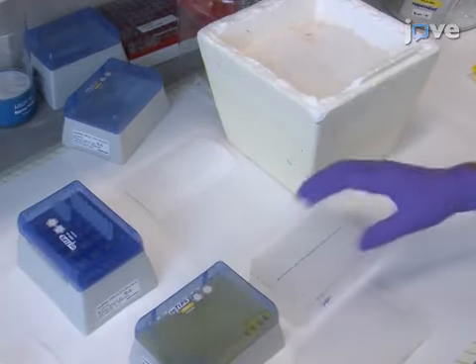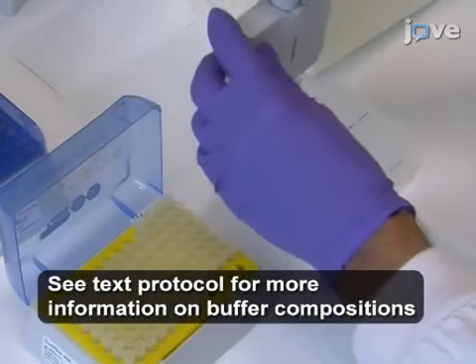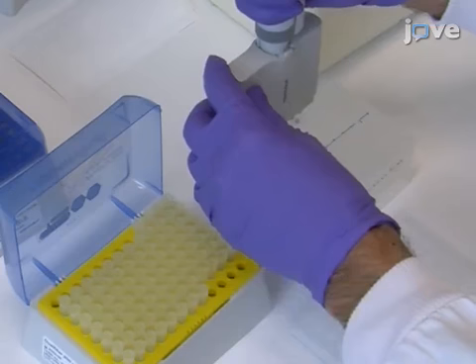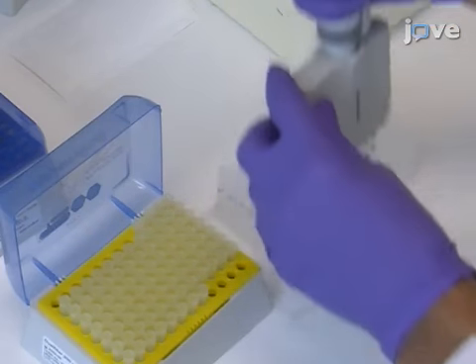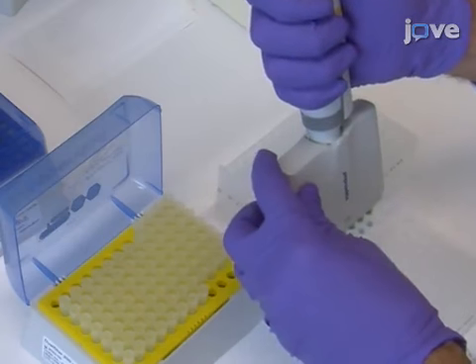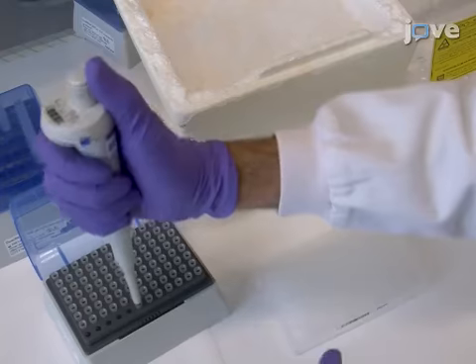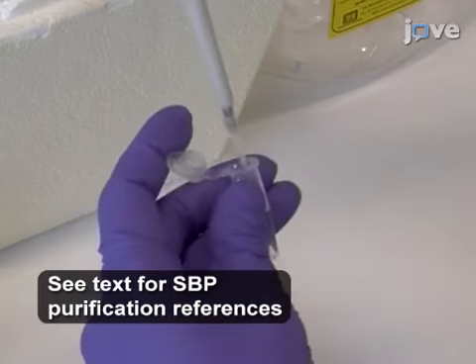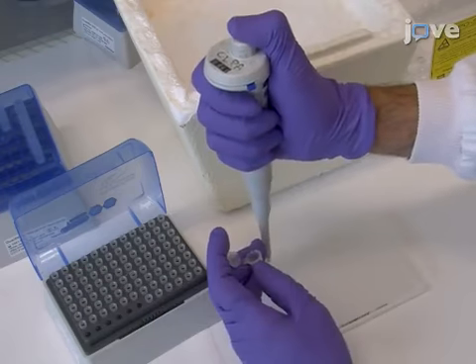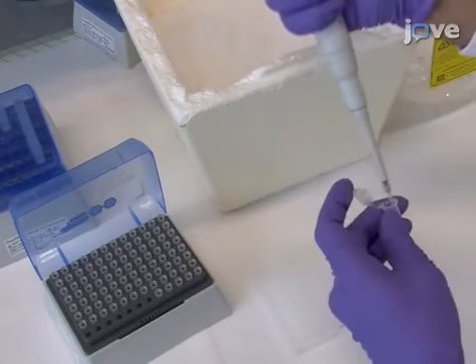First, prepare 48 buffer solutions with a pH range of 4.0 to 9.5 and sodium chloride concentrations ranging from 0 to 0.5 molar. Dispense 40 microliters of each solution into a 96-well plate. Obtain a purified solution of the chosen substrate-binding protein. Add 5 microliters of the SBP solution to each well for a concentration of 1 to 2 milligrams per milliliter.